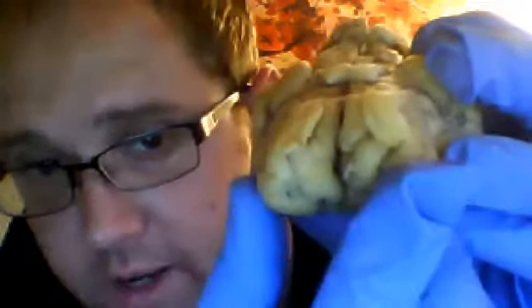So let's go ahead and point out some more structures. Let's look at this view of the brain here showing the olfactory bulb. When you're looking at the brain, on the underside, you have these structures. They're located right here at the very front of the brain. They're right there on the frontal lobe. And these right here, you turn it over.